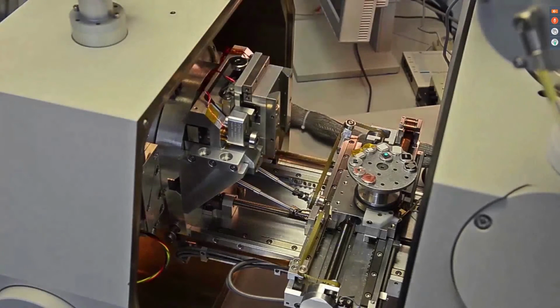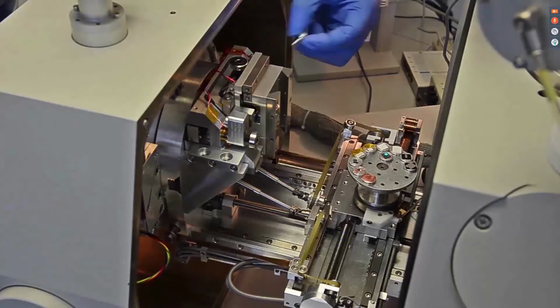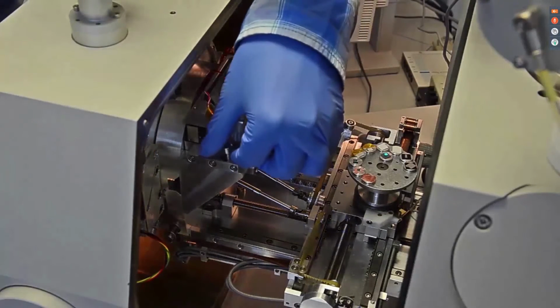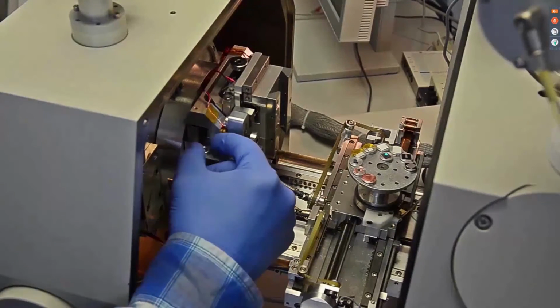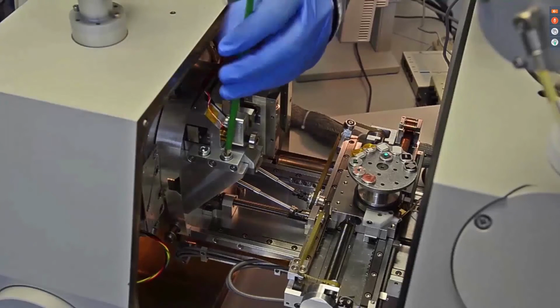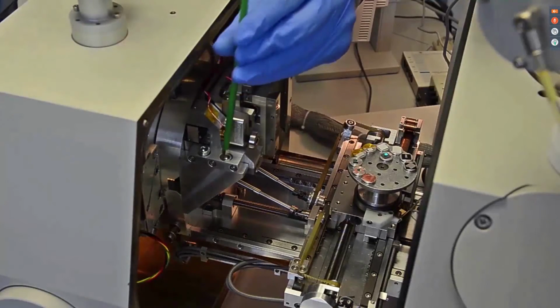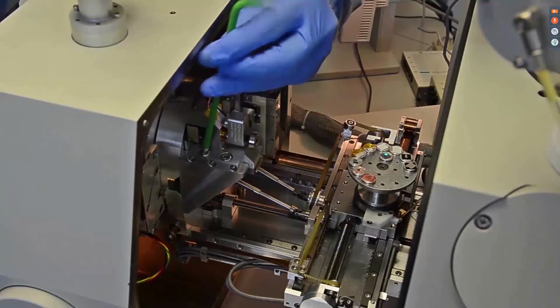In every other SEM, these adapters might look a little different, depending on the SEM that you use. However, regardless of the mechanical mounting system, all integrations have one thing in common. The integration is realized seamlessly, meaning that your SEM stays as it is and nothing has to be changed mechanically. All mounting points are already available in the SEM when we mount the AFSEM.